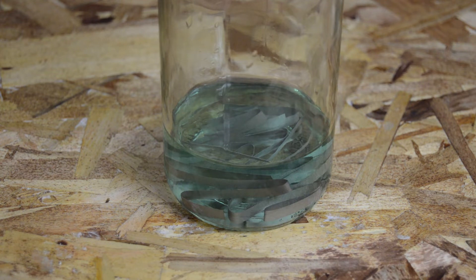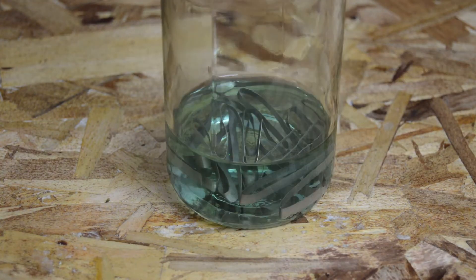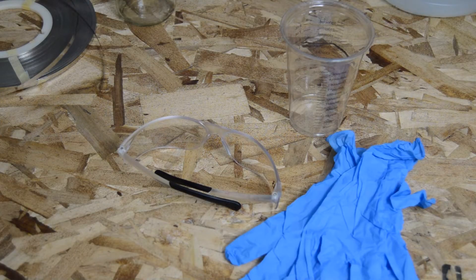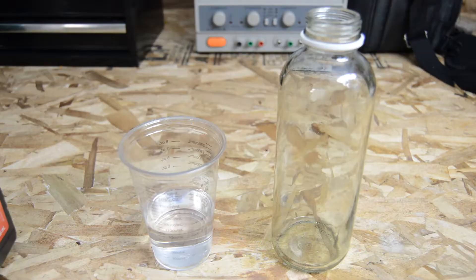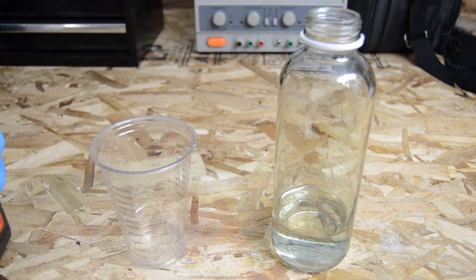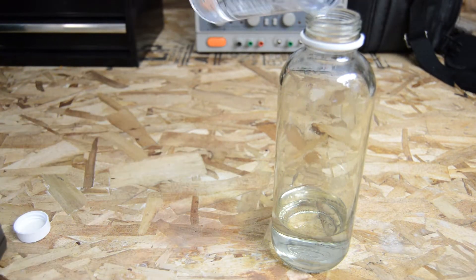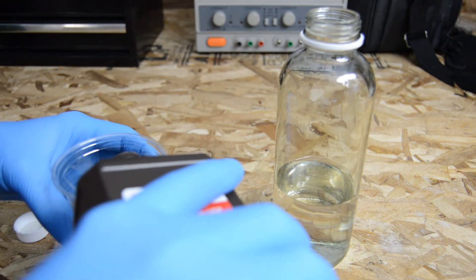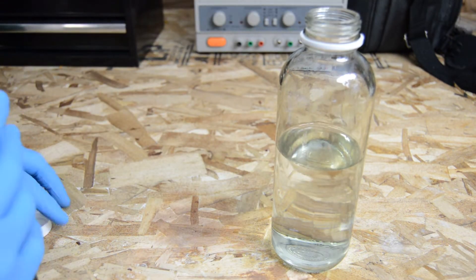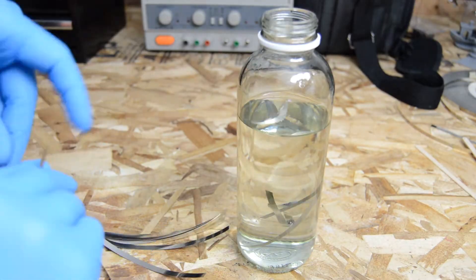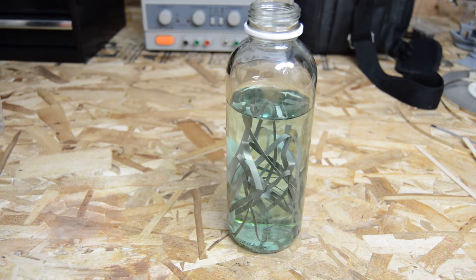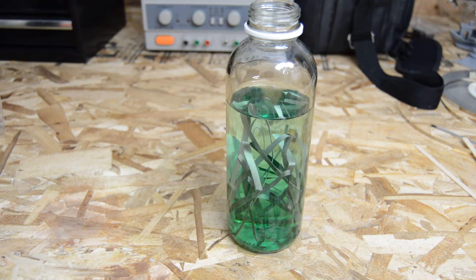Antiseptic or topical grade hydrogen peroxide should work just fine and can be purchased in 3% by weight solutions. To create my nickel sulfate crystals, I used 300 milliliters of 3% by weight hydrogen peroxide and 85 milliliters of battery acid. I then added about 12 grams of nickel which turned out to be about 9 feet of nickel or 18 six inch strips.